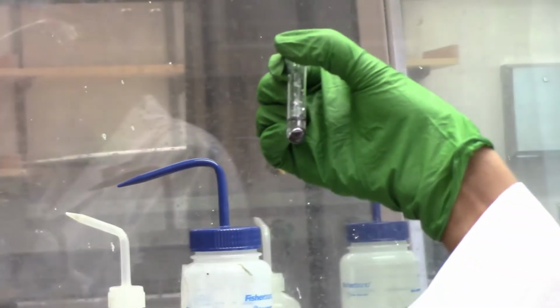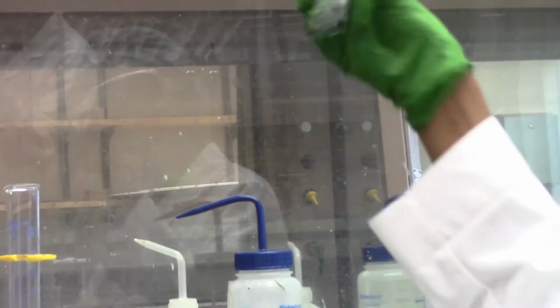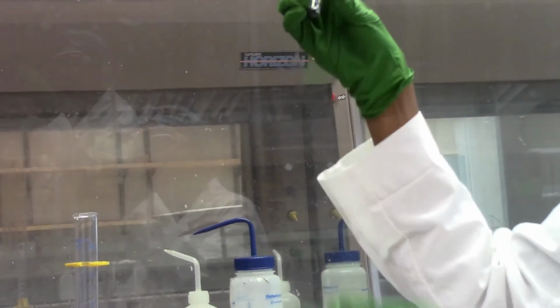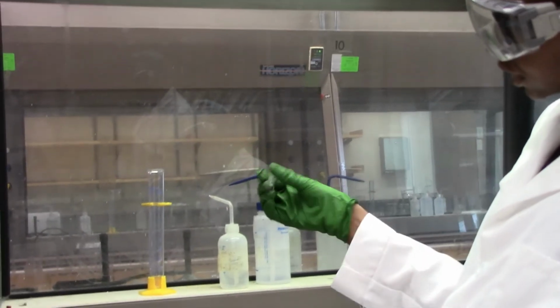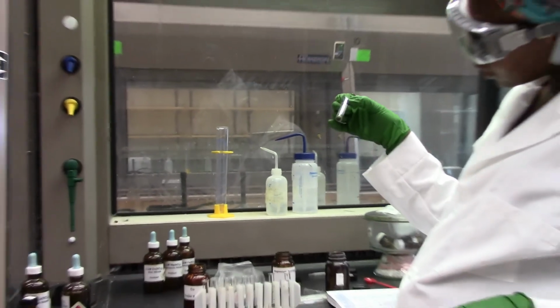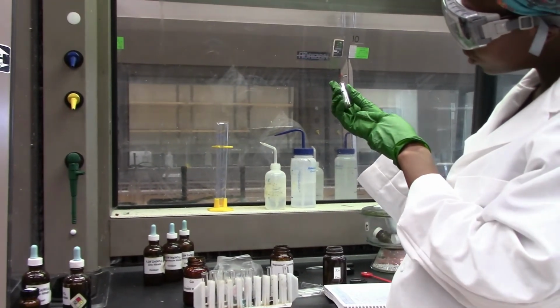Okay, this is very interesting because the copper 2 sulfate, which was blue, is now colorless, and all we have is some black solids. So that should tell us that there was some reaction that happened in this test tube. And now the color that was blue is kind of greenish, and we have a gray solid. This was when magnesium is added to copper 2 sulfate.